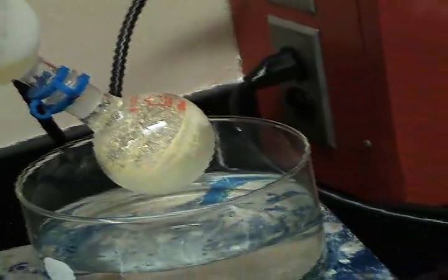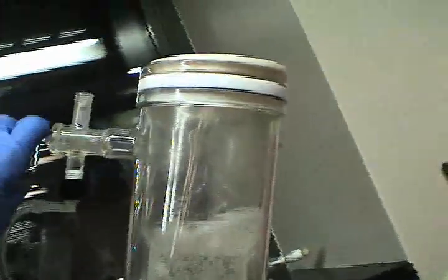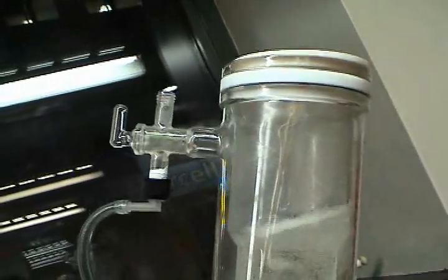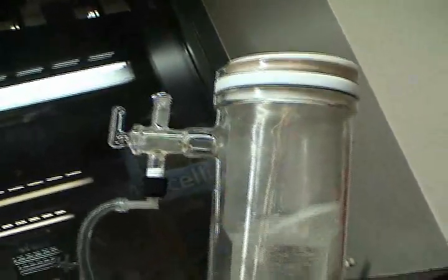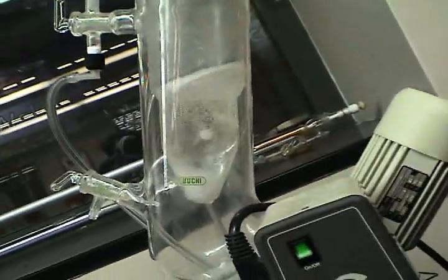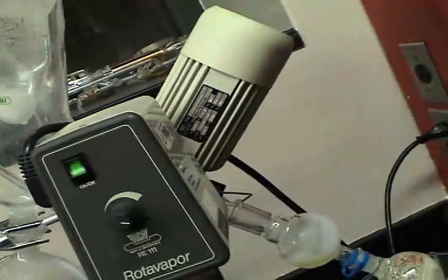How do we turn the machine off? First thing to do is break the vacuum. And that is put the stopcock out towards the atmosphere. That pulls the atmosphere into the machine and increases the pressure. So we no longer have a vacuum.